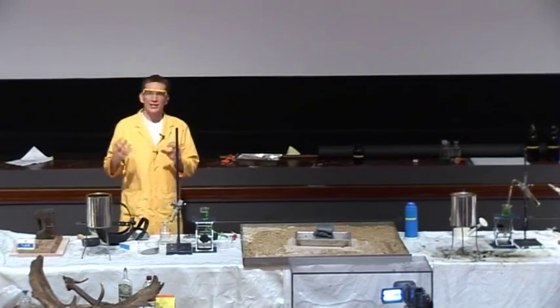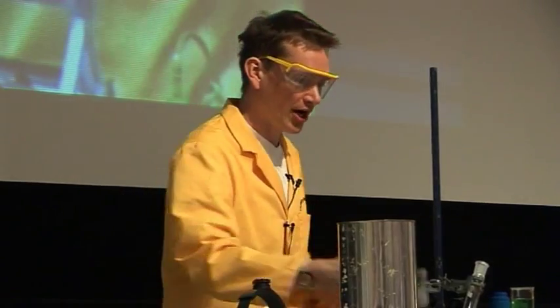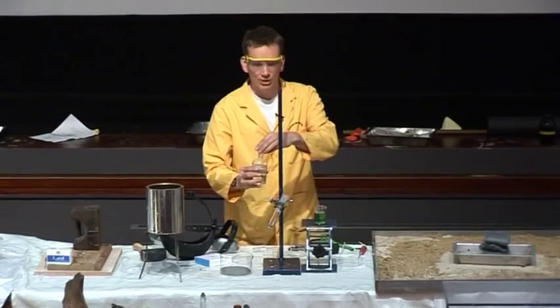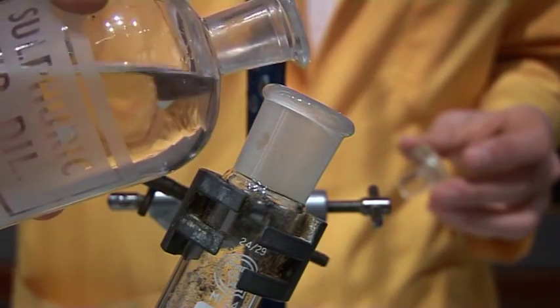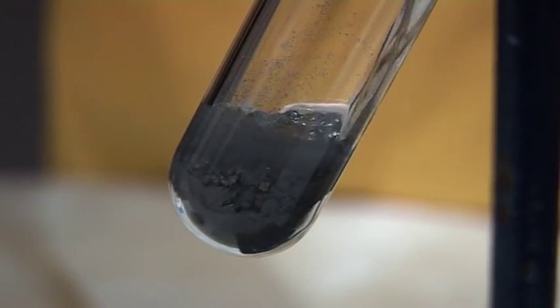We can actually make some hydrogen gas using the metal that we have here. Here we have some iron filings, and if I add acid to this, this will generate hydrogen gas. So let's add some acid. I have some sulfuric acid here. I'm going to add some onto the iron.